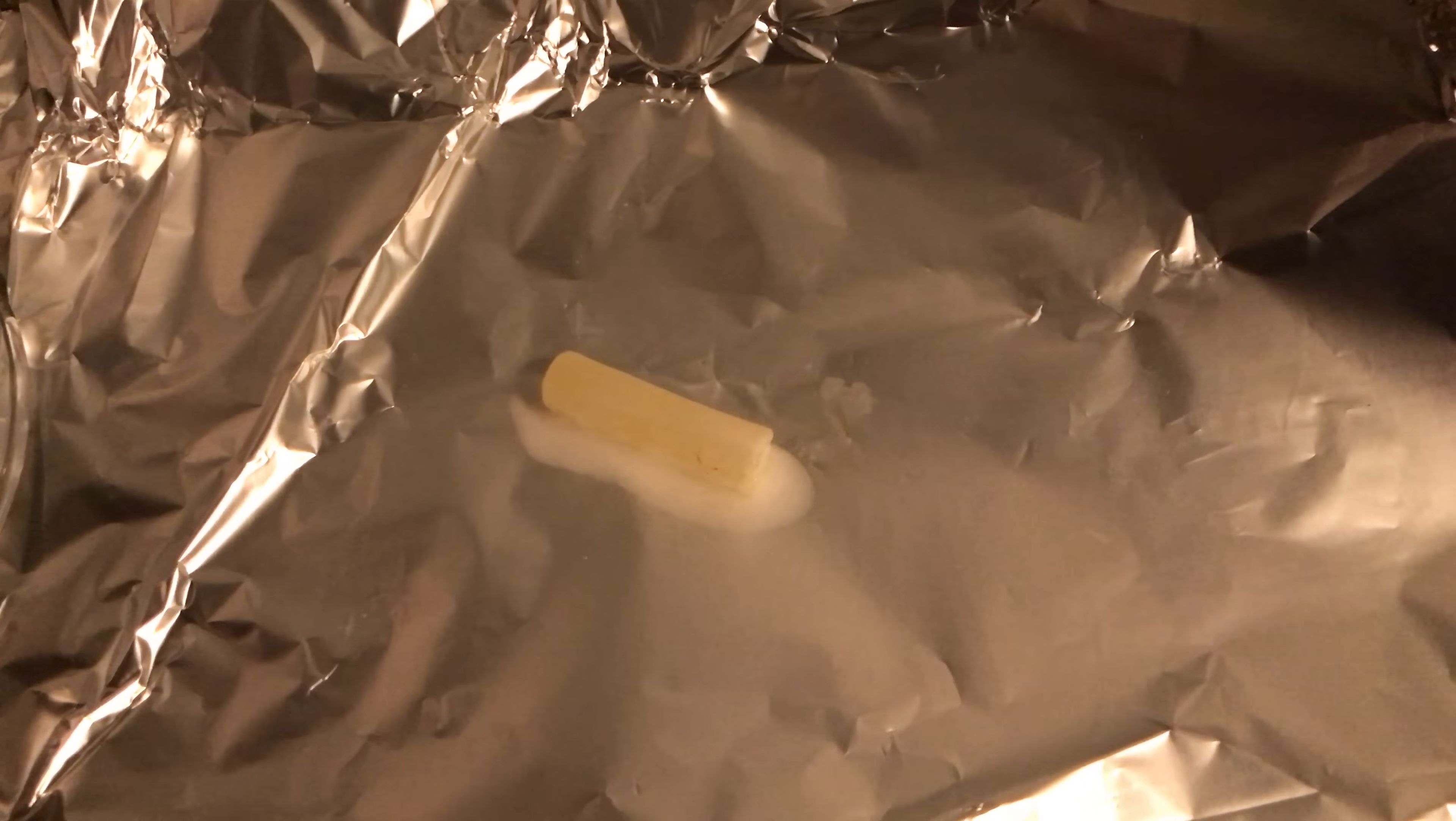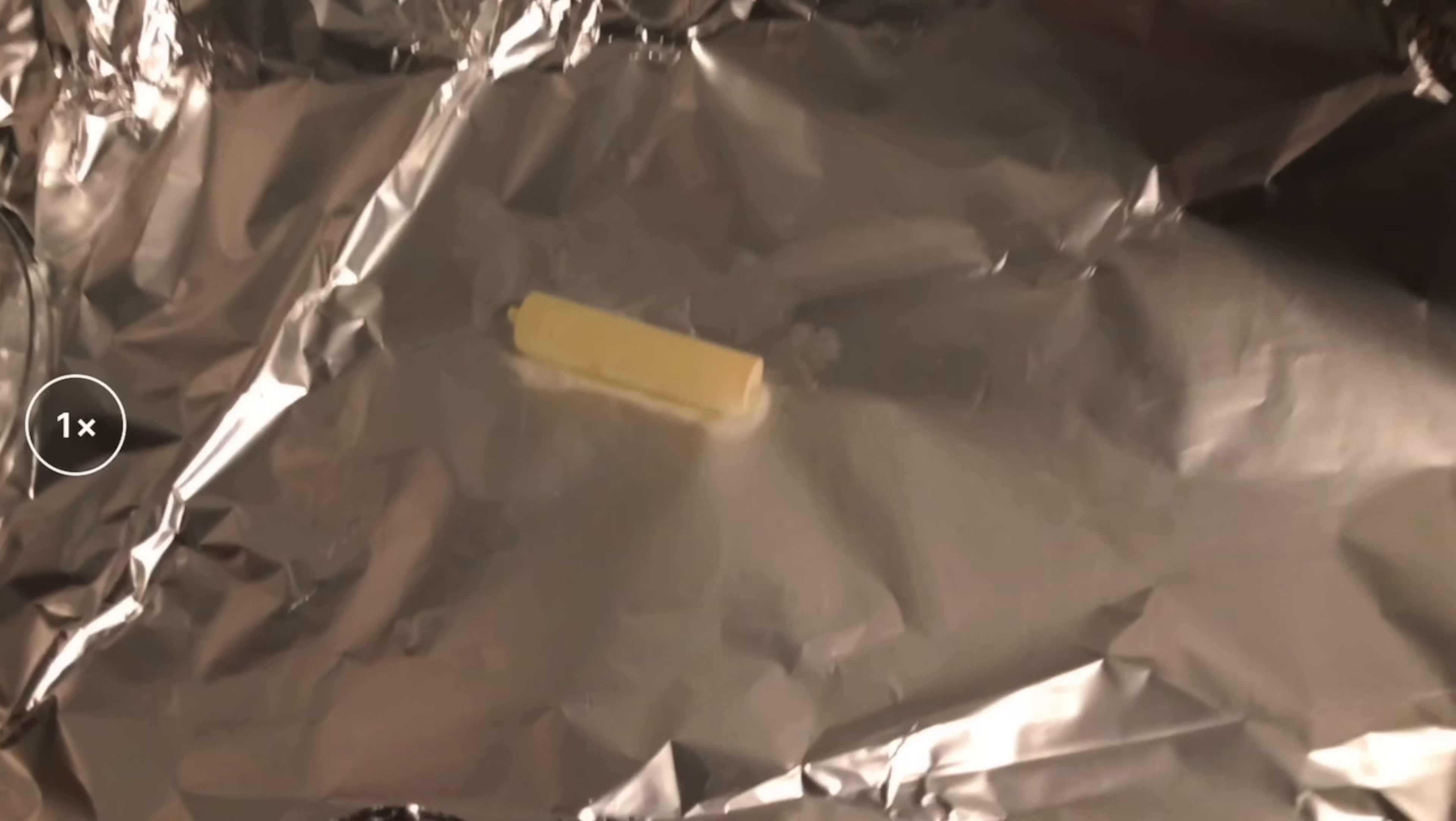As you might know phosphorus glows when exposed to air. Unfortunately my camera is not good enough to capture this, but using a small trick and doing a screen recording of my photo camera I was able to capture this amazing footage. In real life the phosphorus actually glows even brighter than you would think. Where the phosphorus was glowing I noticed a strong ozone smell which we are going to investigate in a few seconds. For the phosphorus to glow brightly it actually needs to be warm enough. I have tried this yesterday when the phosphorus had a temperature of about 5 degrees celsius and it did not glow at all.